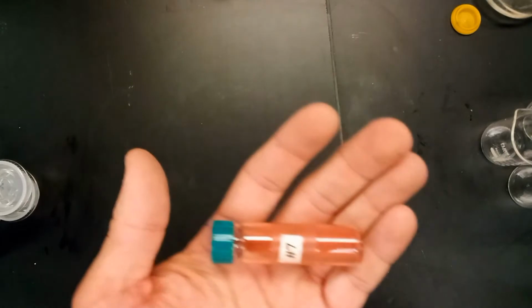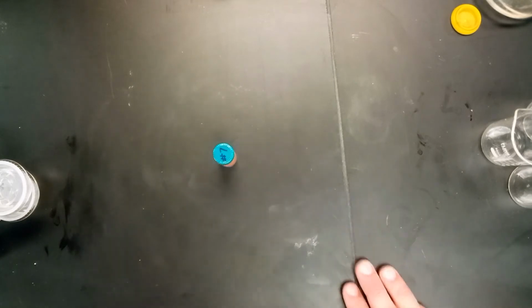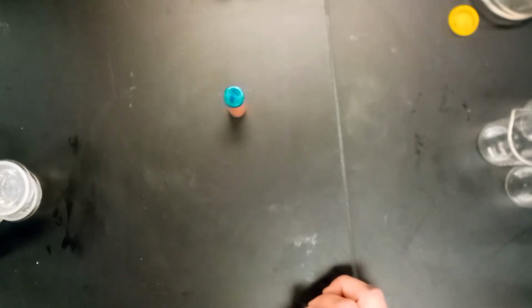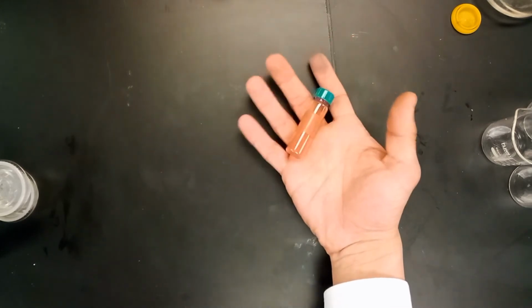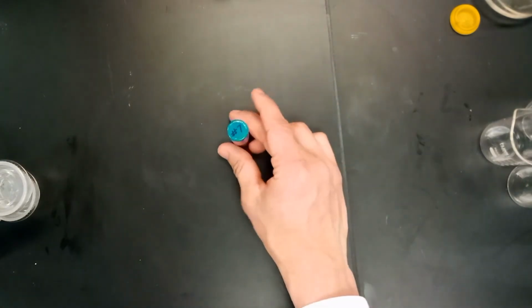And we've got our number 7 here, which very clearly is this bright red powder. If it reminds you of anything, you'll notice how it's a powder, but it's colored. Which reminds me personally a little bit of the copper. Wait, what was it the other day? We used copper(II) sulfate, which was blue. So it gives you an indication that it's sort of ionic, because the color is probably affected by the ions in it.